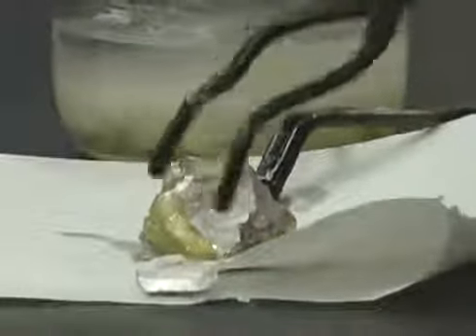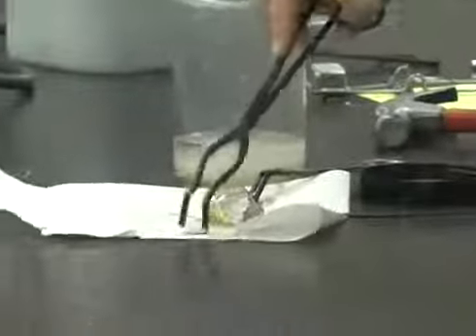You see, it's a silvery. This is sodium. Yeah, this is sodium. It's a silvery metal. It's very shiny. When you cut it, it's kind of oxidized. Let's get it in here.